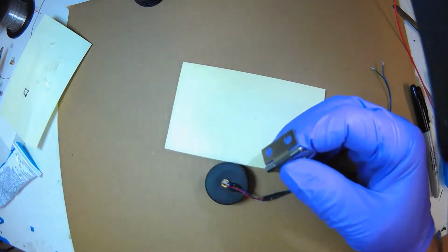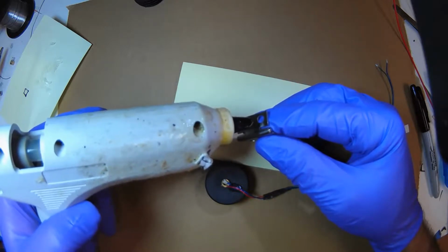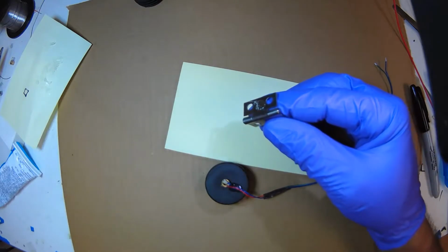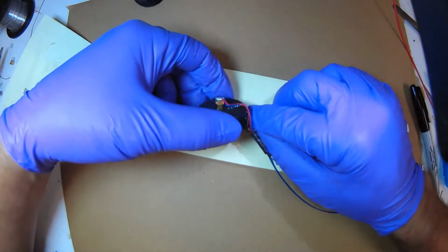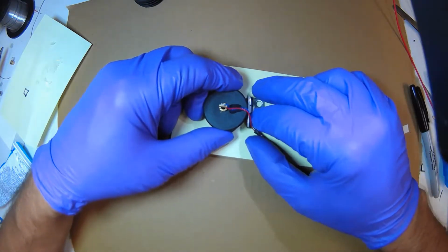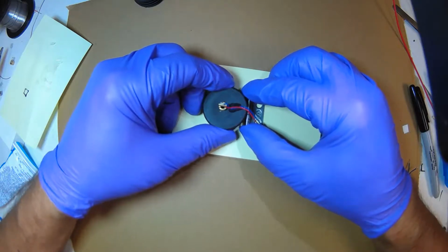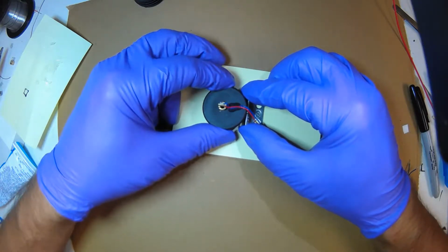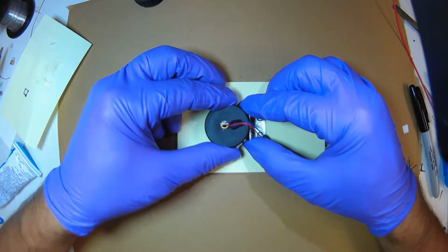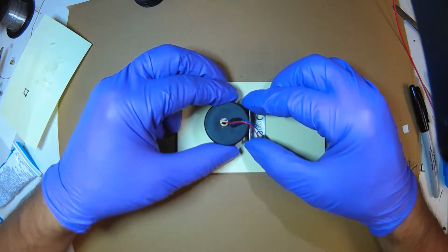And here we go. A little hot glue, just enough to tack it in place. And I'm going to put it here. Make sure the orientation's right angles, and let it dry here. This is sort of like welding. You tack something and then you go back and finalize.